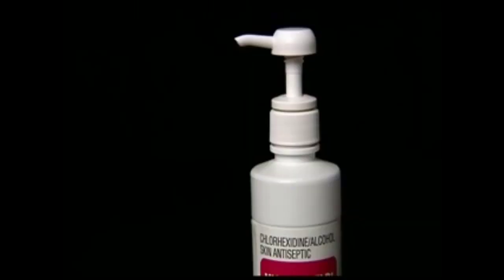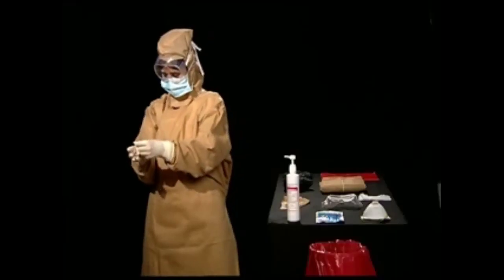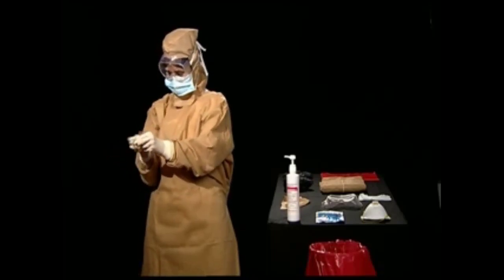First to come off are the hand gloves. Insert the index finger under the glove and roll it up in a manner wherein it slides over itself as it comes off.